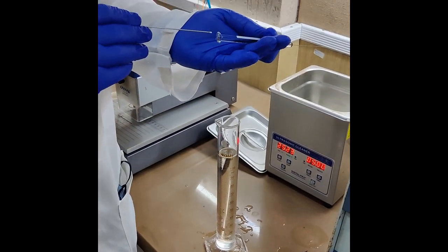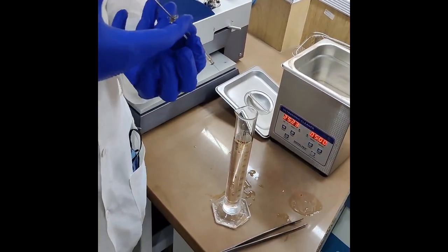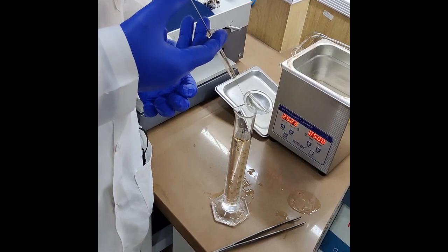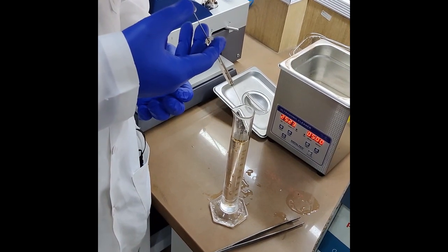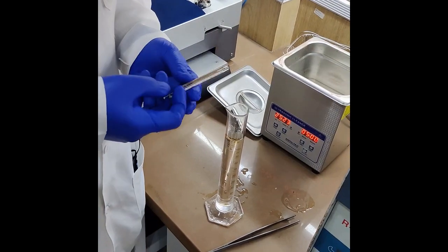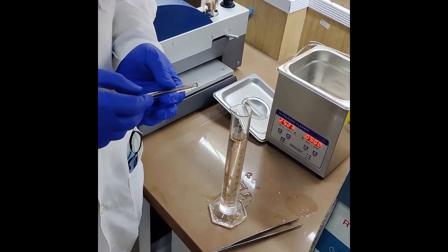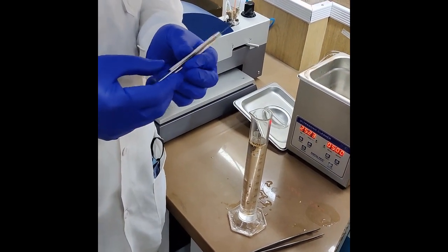Once the syringe is removed, put the piston inside the syringe and now try to push and see whether the block is cleared. If the solvent comes out of the needle tip, it indicates that the syringe is cleaned. You can now use this syringe for your routine HPTLC analysis.